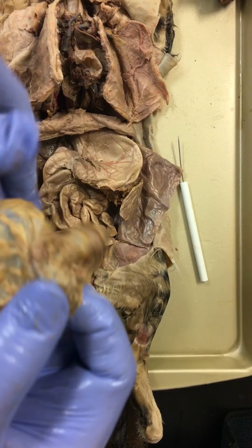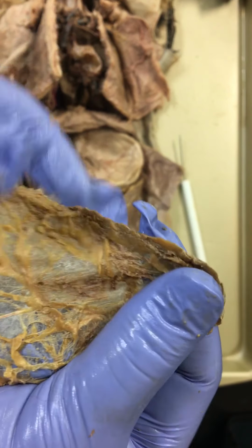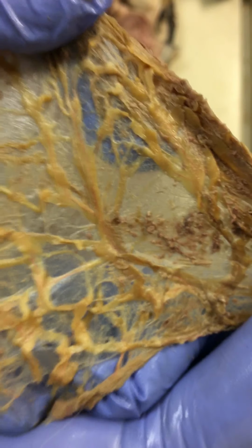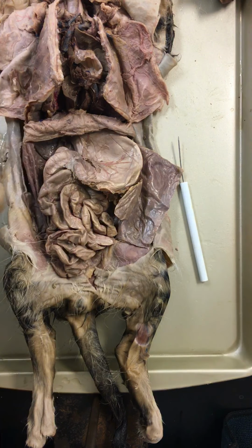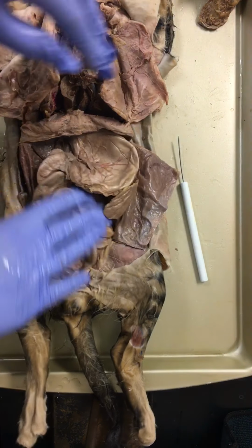It does have fat in it. This one has, you can see the yellow fat. It's made of connective tissue and elastic connective tissue in that. And we can see a few things in here. One, that netting is incredible. It increases surface area. It's allowing for the distribution of nutrients. It's a protective covering, allowing for lubrication. It's also protecting your intestinal tract so they don't come in contact with the musculature behind it. And that's your greater omentum.